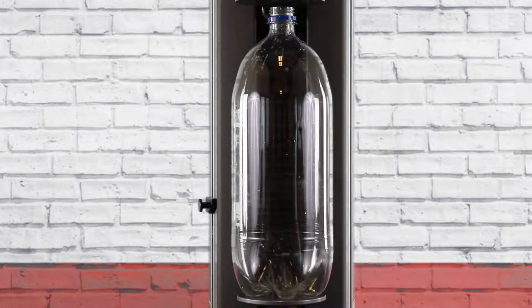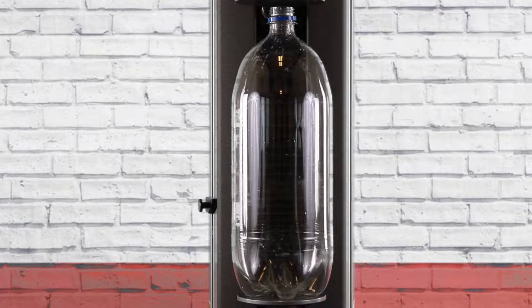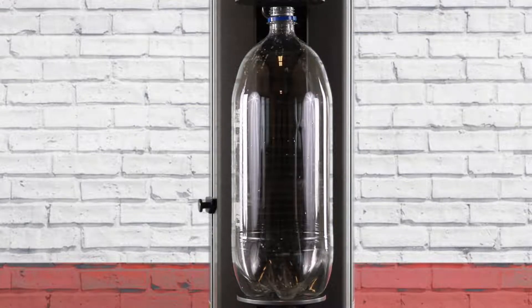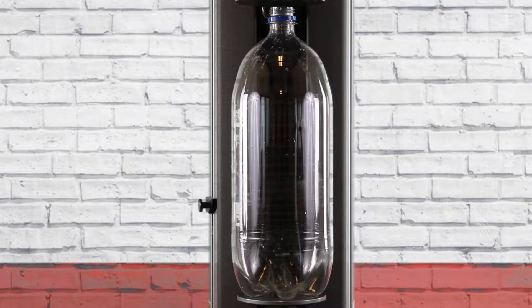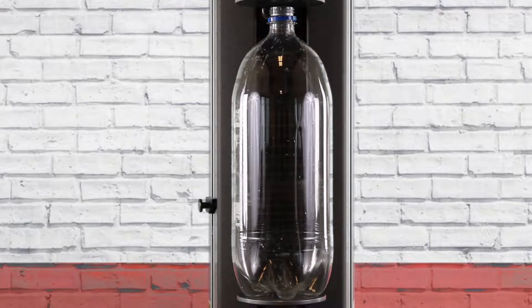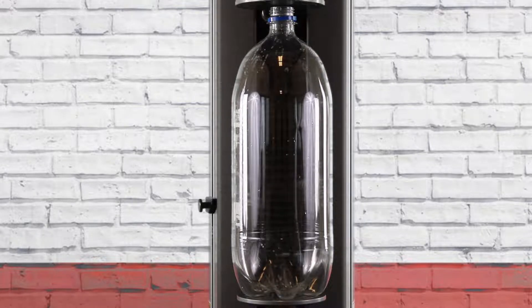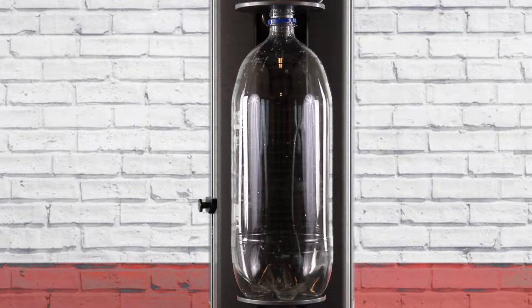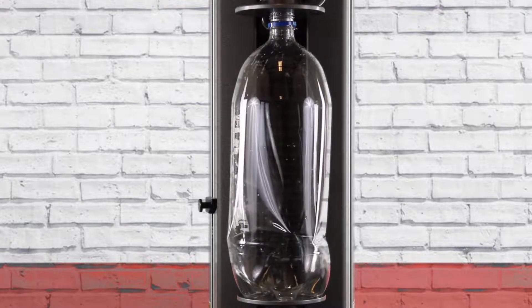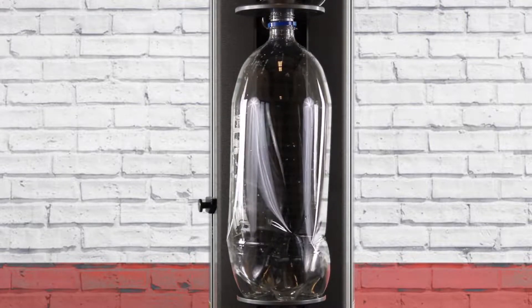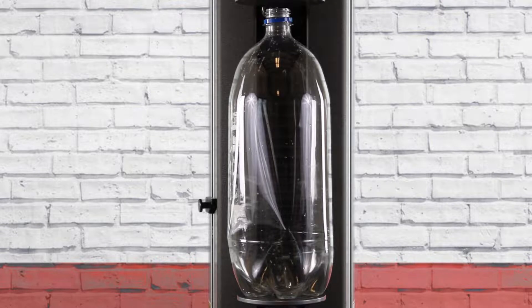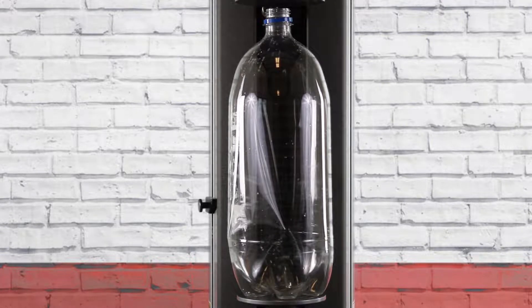Last time we did a small bottle so now we're going to be doing a two liter bottle. Let's hit start test and you'll see the system coming down, touch off on the bottle, it's going down, there we go and that's the first test.